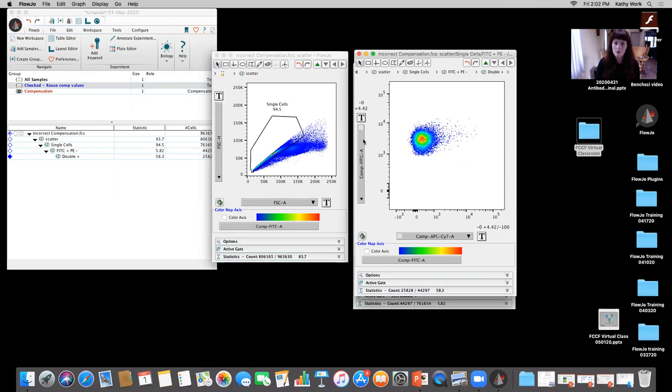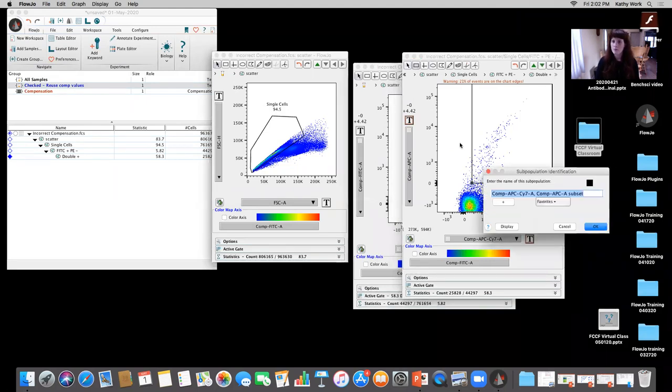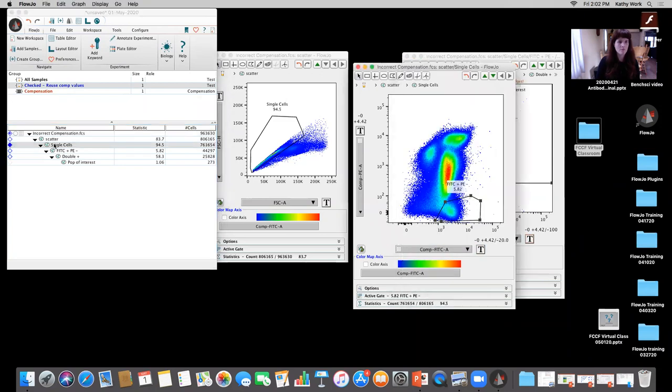Okay, APC-Cy7 and APC. I missed out on one gate for viability, so I'm going to go ahead and draw that back in. And this is the population of interest. Okay, so this is the population of interest. I did forget to include the viability gate that was based off of AmCyan.